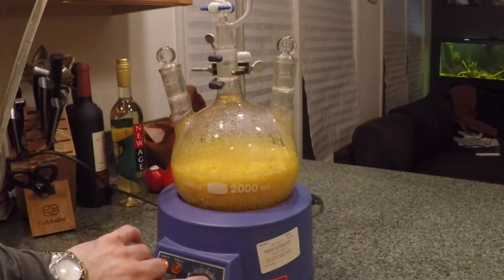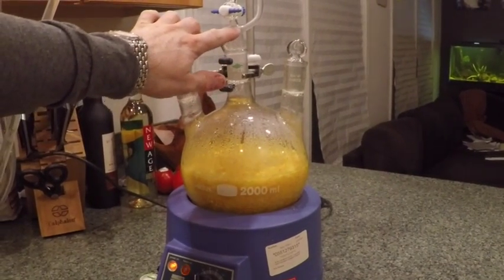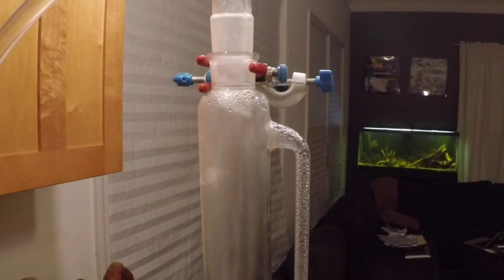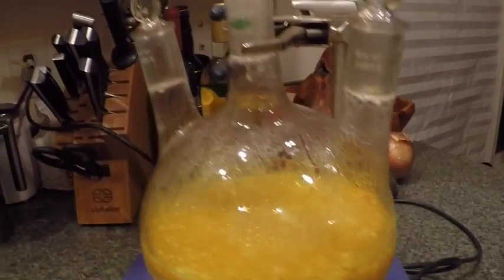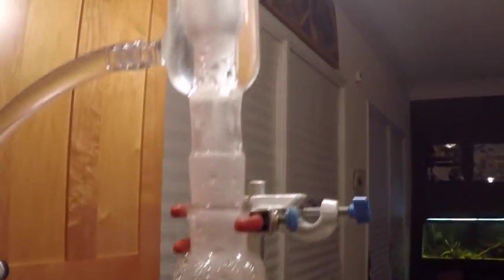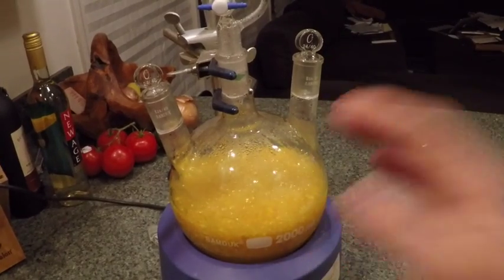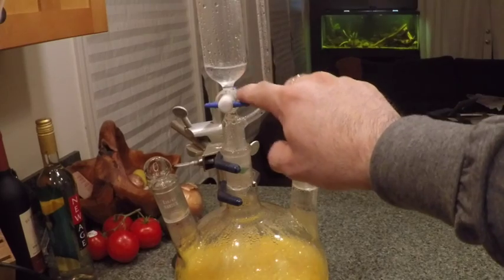It's starting to bubble. I've turned the temperature down a little bit just to make sure that we don't burn the oil. You can see the vapour — here it comes, right now. The first drop's full — now we're cooking with gas. We're getting our first water and oil collection here. We're boiling nicely and we've got a nice layer of oil on water.